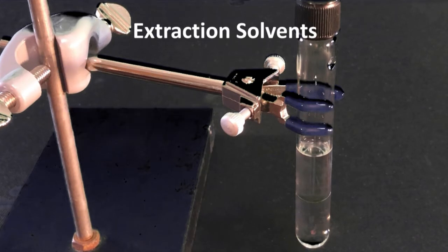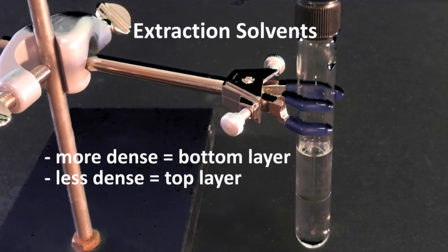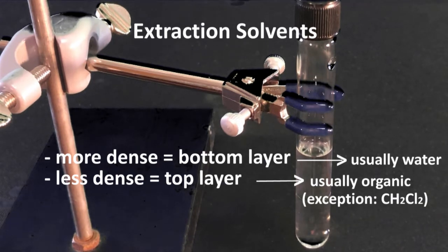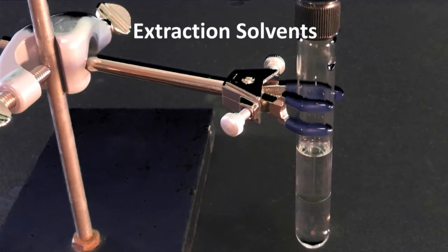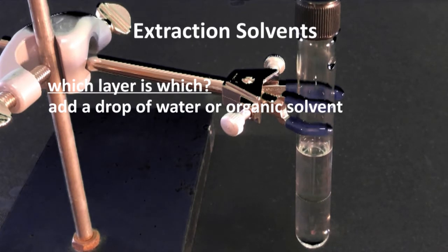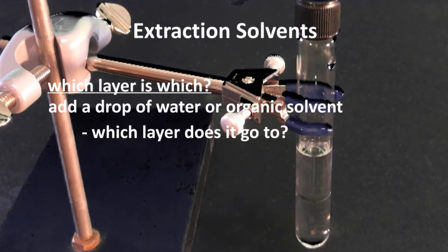How do we know which layer is which? Density. The more dense solvent will be the bottom layer, and the less dense will be the top. Consequently, the aqueous layer is typically, but not always, the bottom layer, and the organic is the top. One solvent that breaks this rule is methylene chloride. It has a density of 1.325 grams per mL, so it will be on the bottom. If you are having trouble determining which layer is which solvent, you can add a drop of either solvent, water or organic solvent, to see which layer it goes to.